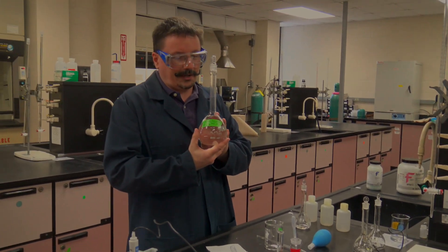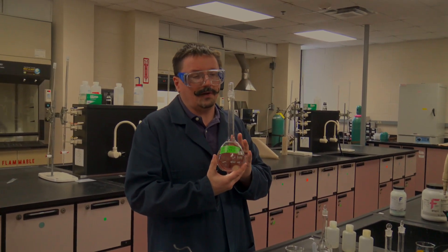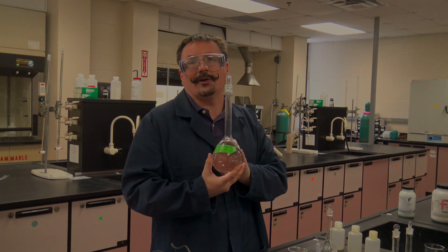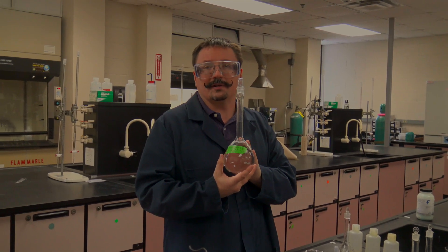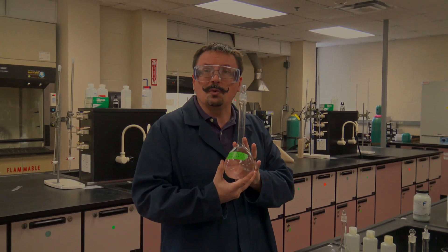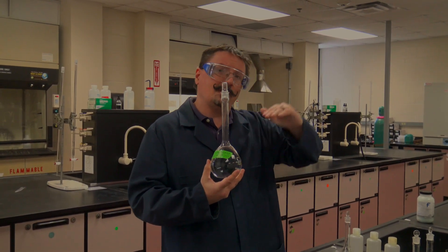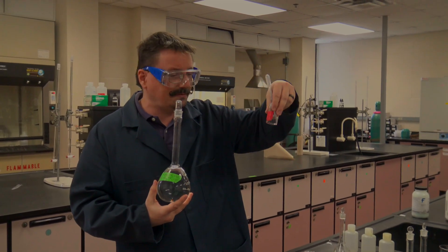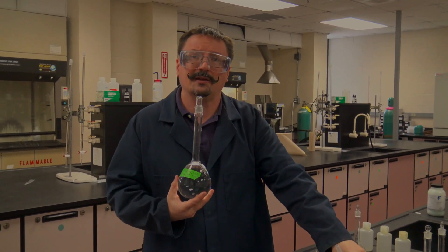Add just a little bit of sulfuric acid to get it dissolved. Your graduated cylinder won't be able to measure half a milliliter, so I'd add about eight or nine drops of concentrated sulfuric acid. This will get it to dissolve without making it super acidic, which means later when you bring the pH up, it'll hopefully only take about 30 or 40 drops of your sodium citrate.